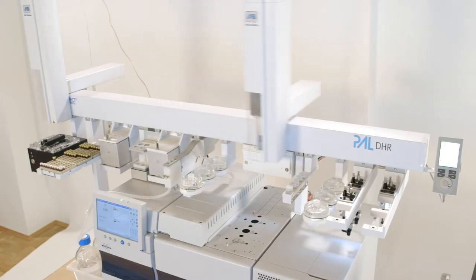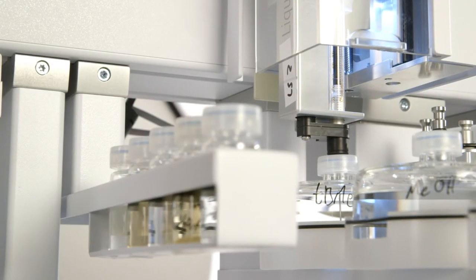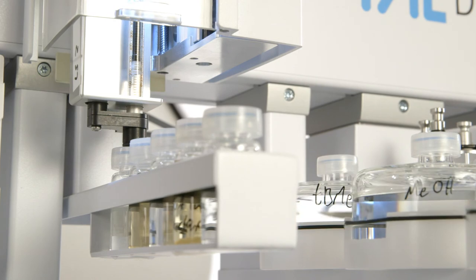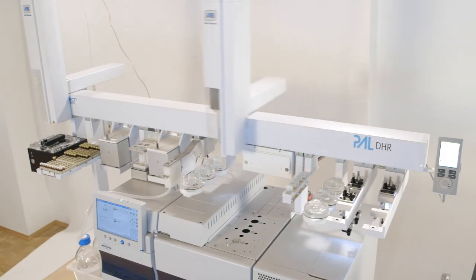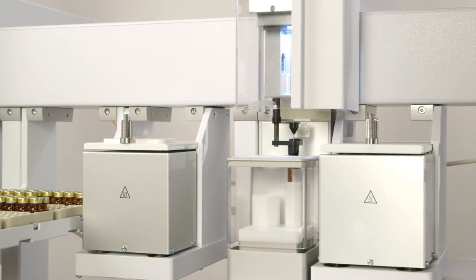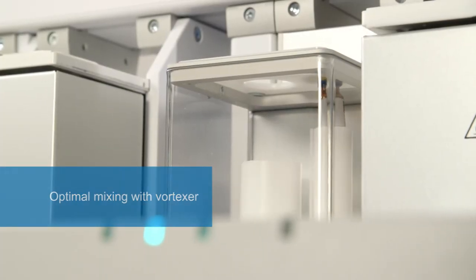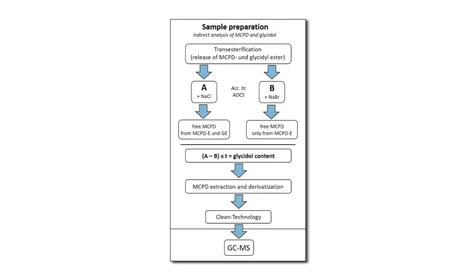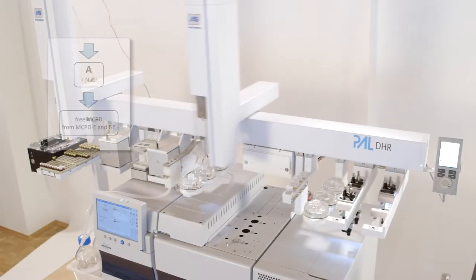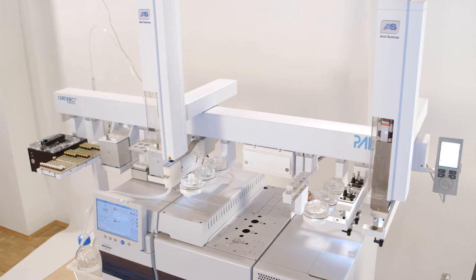The second sampler takes solvent and internal standard and adds them to the sample. In order to determine the Glycidol content, two parallel transesterified aliquot samples are required within the sample preparation. Due to the different reactions, the MCPD and Glycidol content can be determined by subtraction.